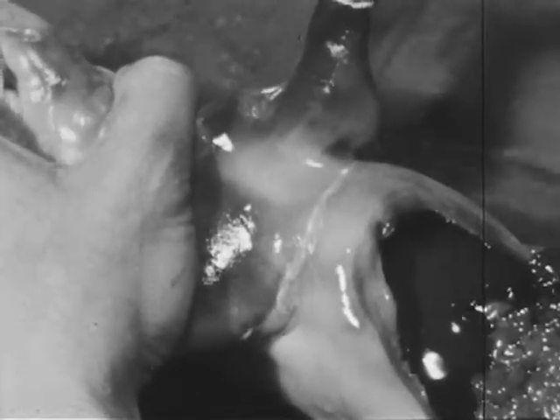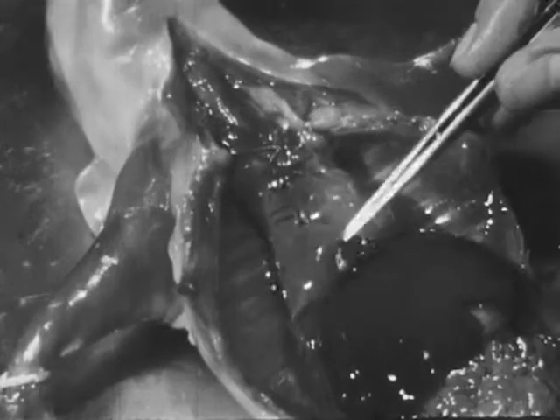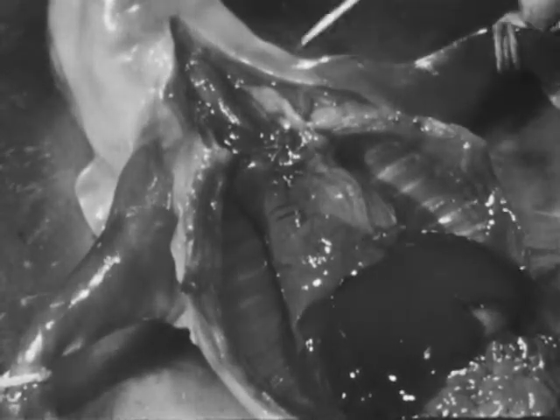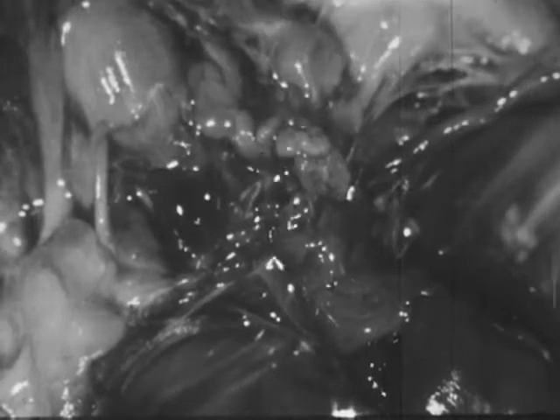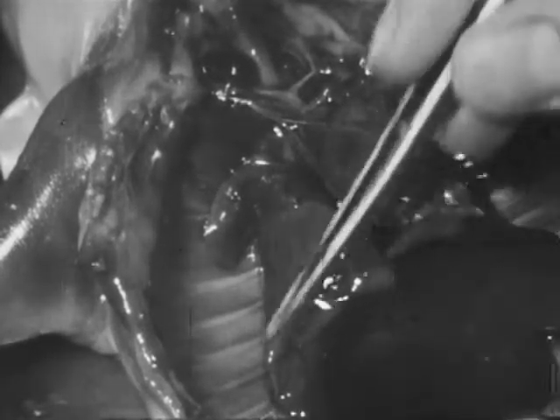Next, the organs in the neck and thoracic cavity will be examined. The most obvious organs in the thoracic cavity are the heart and the two lungs. The thymus gland is also prominent; it extends from the neck into the thoracic cavity. This is the thyroid gland, which plays an important part in the control of metabolism. Smooth pleural membranes line the thoracic cavity and cover the lungs. A sac-like membrane, the pericardium, encloses the heart.